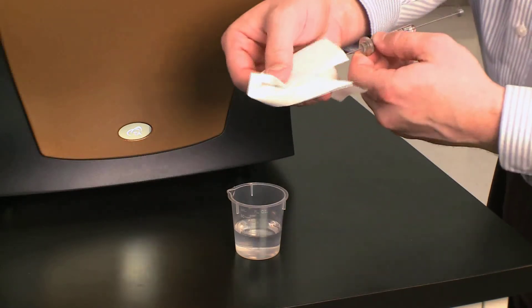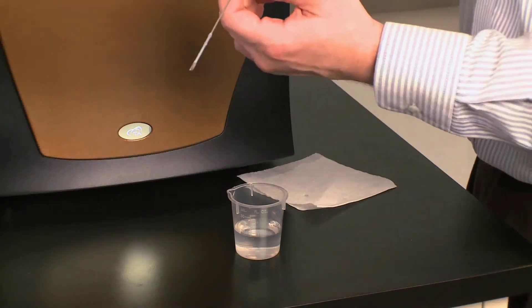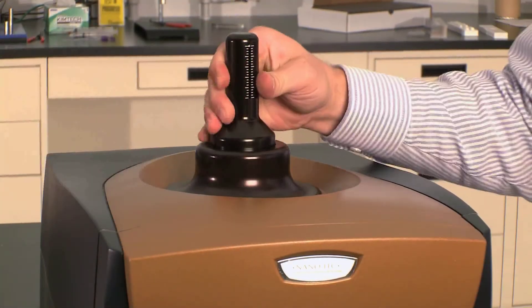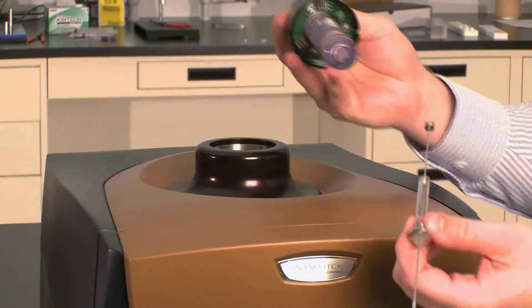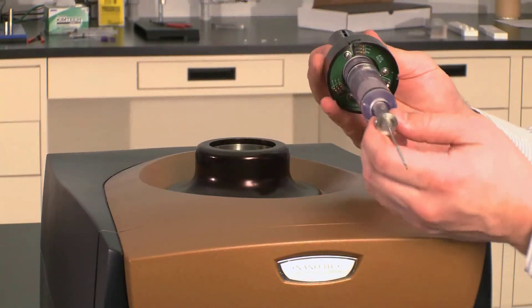So I'm going to clean and dab this. And now it's ready to place inside the burette. So you remove the burette handle. Place the full syringe inside the burette handle.